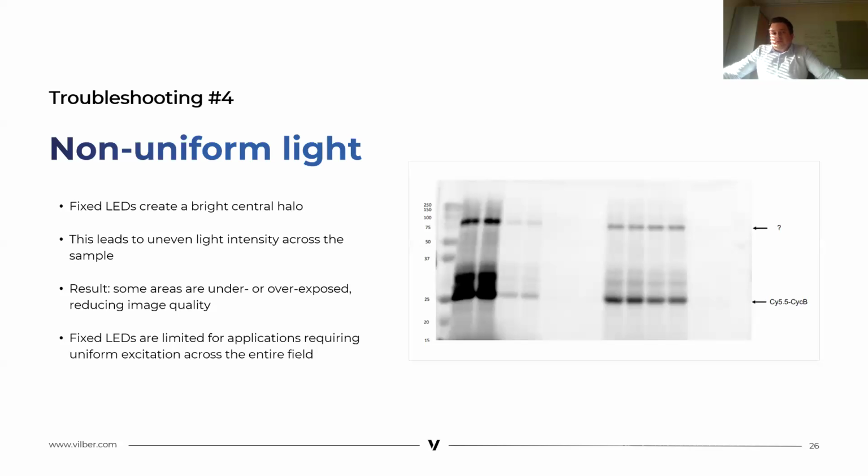I think the most important troubleshooting here is the non-uniform light. It's due to fixed LED, because fixed LED creates a bright central halo, which causes uneven light intensity across the sample. As a result, some areas may be under or overexposed, reducing image quality. And fixed LEDs are therefore limited for applications that require uniformity across the entire field. For example, if you have a big membrane, it will be impossible to have a uniform light. So sometimes you don't detect your protein at the corner, for example, of your membrane.